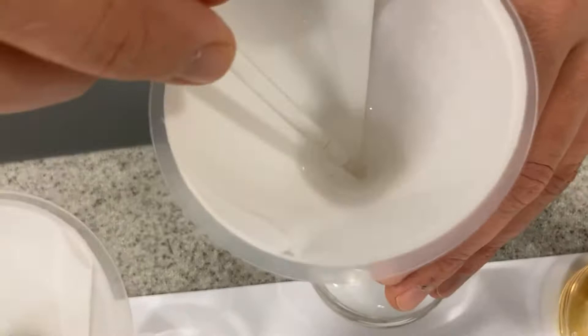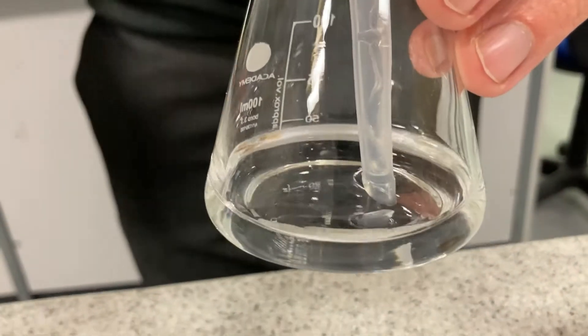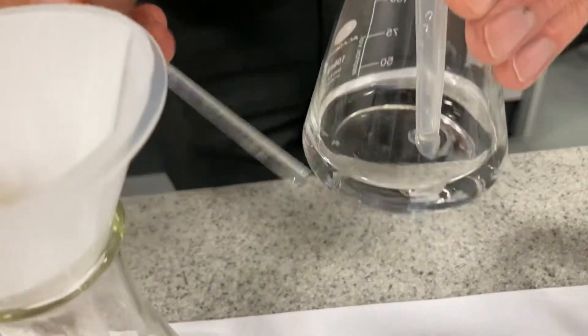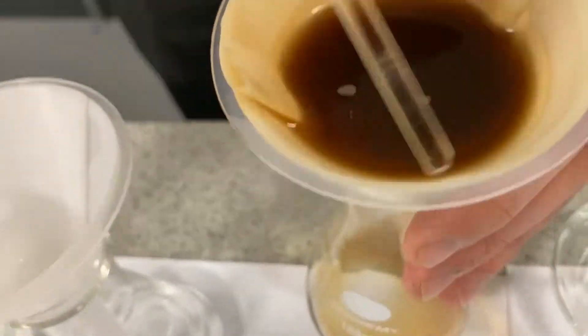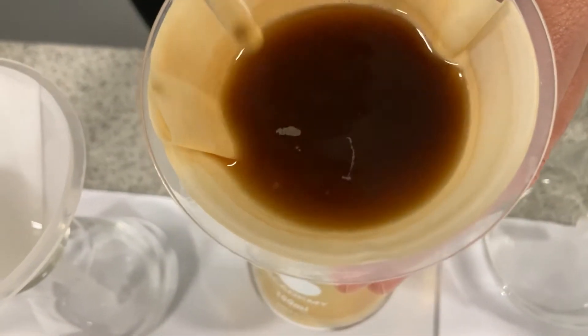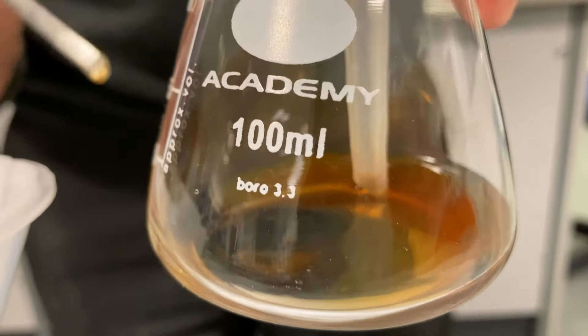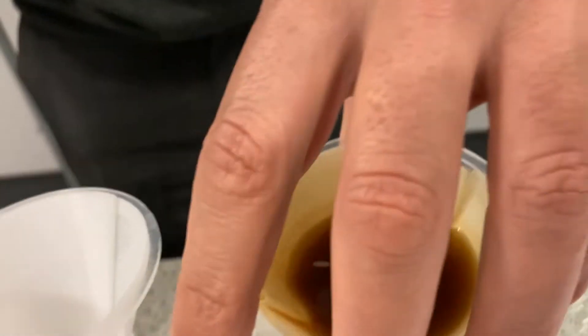This one is sugar — now it's hard to know what's happened here because you can't see anything. There's no residue. The sugar dissolved and there's no residue left in the filter paper. The water's gone straight through. My guess is the sugar must be in the filtrate somewhere. Here's the coffee — it dissolved and it's a different colour, not transparent, but it's going through. Down there it's definitely going through — the coffee has dissolved in the water and gone through, just taking its time.